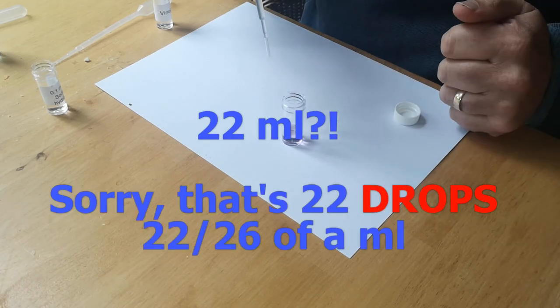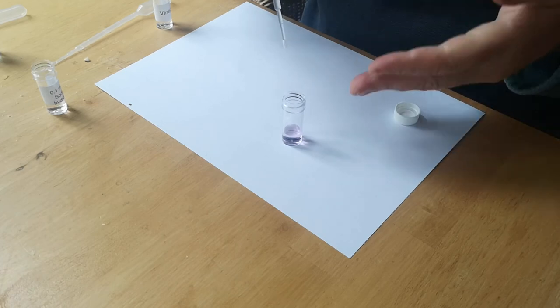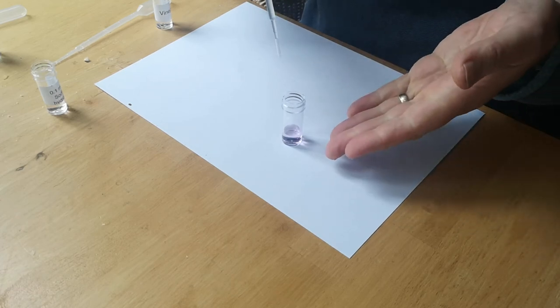There we are. Now you can repeat it if you wish, but there is no need. So you keep on going until you get your permanent color change.